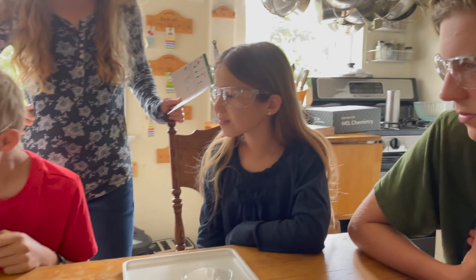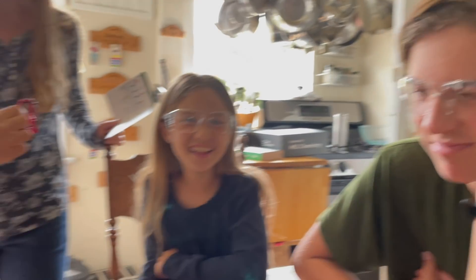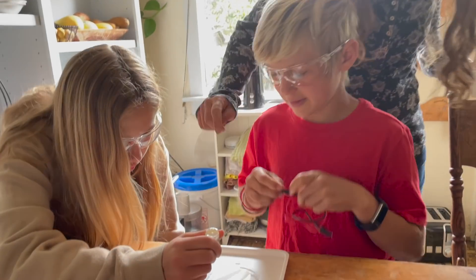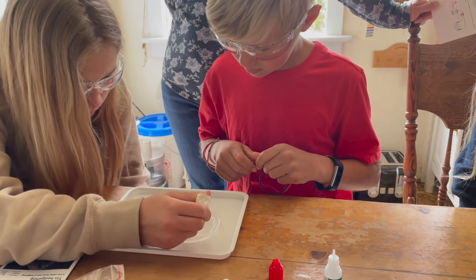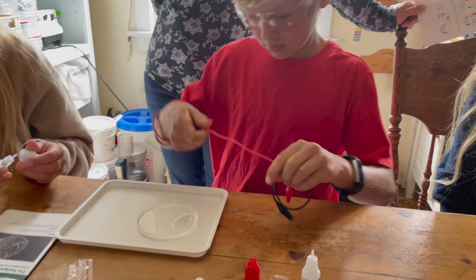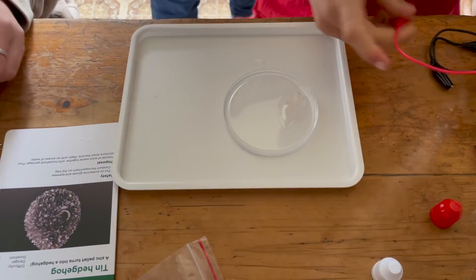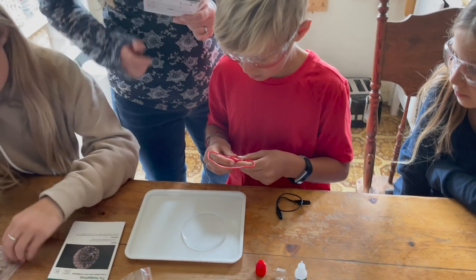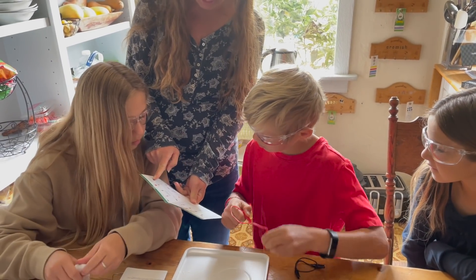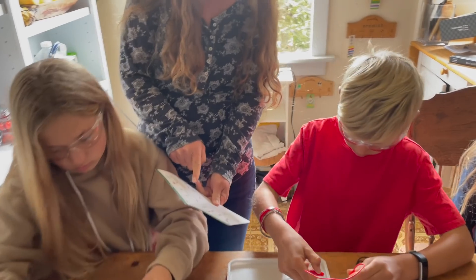And then Jeremiah, get the electrodes ready. Okay, he's doing better. This is electrical. One red and then one black on the other side. Now put the electrodes in the solution. The clips should be touching the solution, one on each side. This is when it gets wild.